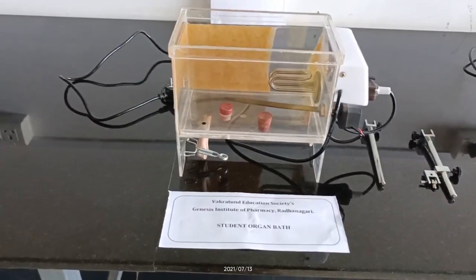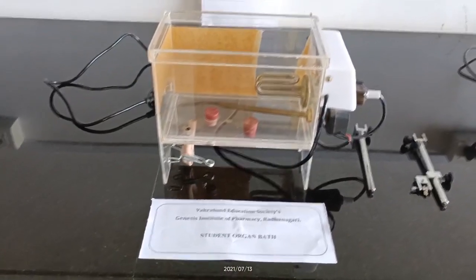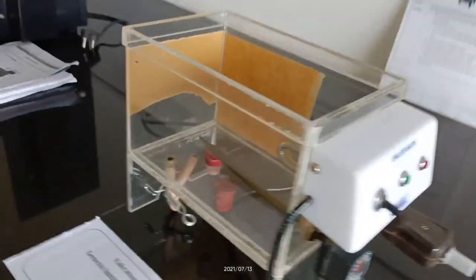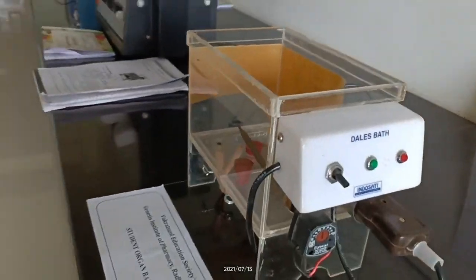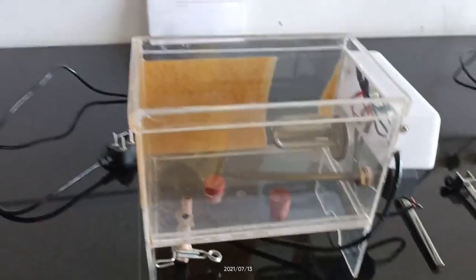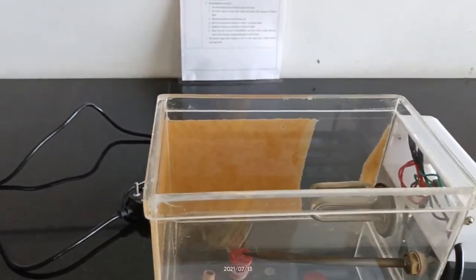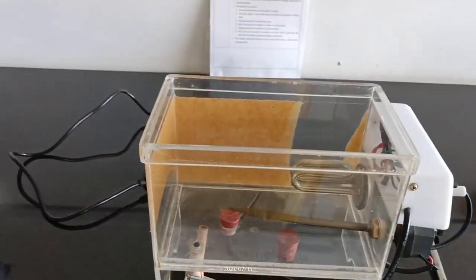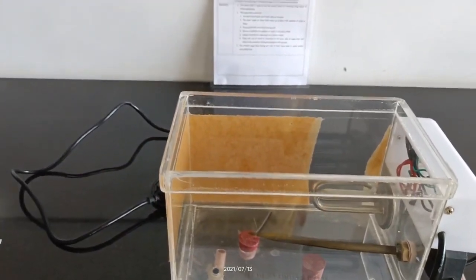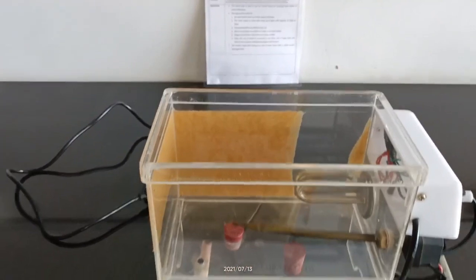So let's move towards the actual instrument, that is the student organ bath. This is the student organ bath instrument. The student organ bath is a tissue bath which is used to put animal tissues for studying drug action.